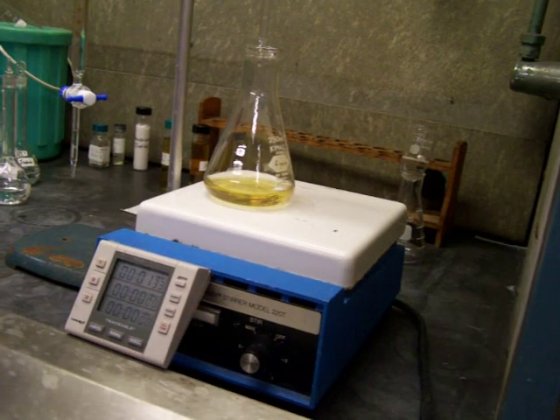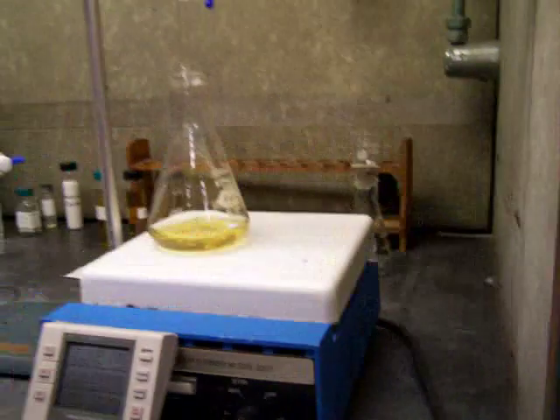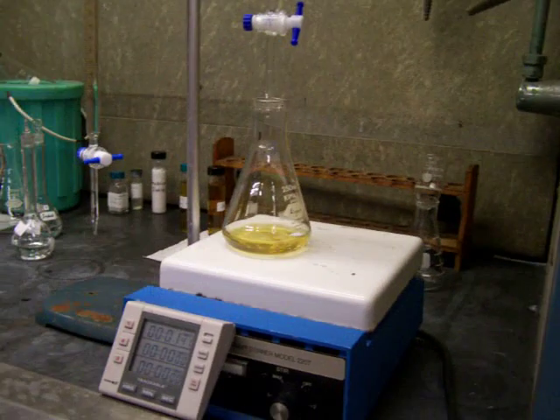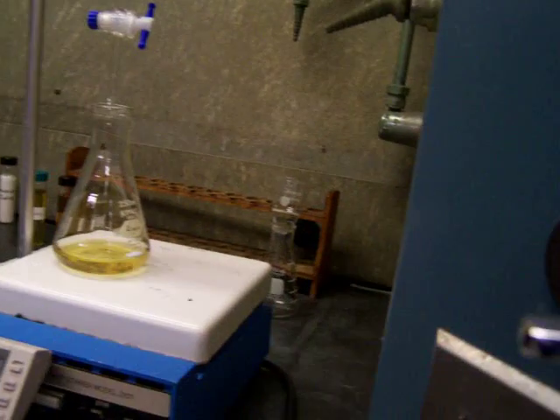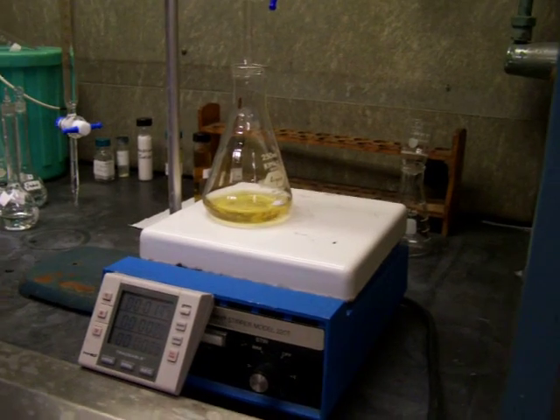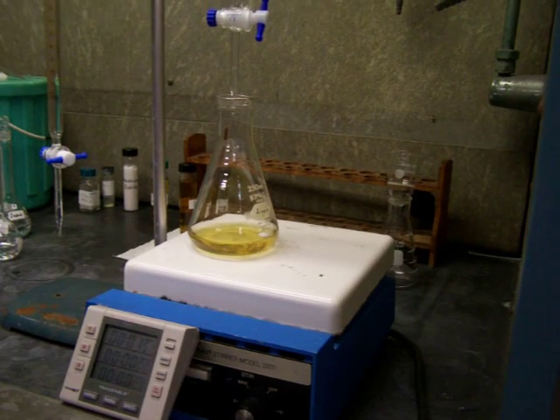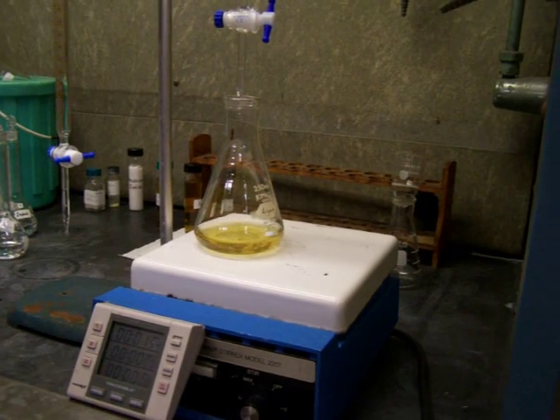Oops, that's bad. Jesus Christ. Okay. Hey, yes, that's exactly what it is. Thank you for following. Yeah. Sorry, I'm not sorry. This is your lab, and later things didn't work out. And you all look at me like I'm the pope, and you're making a simple mistake here.